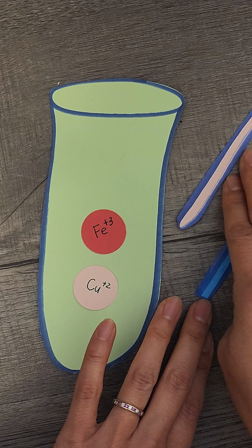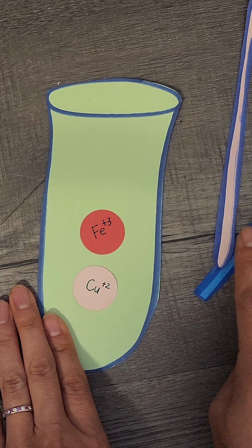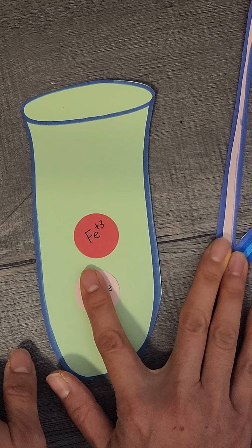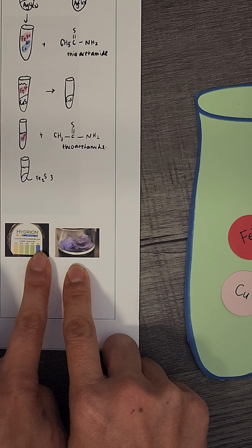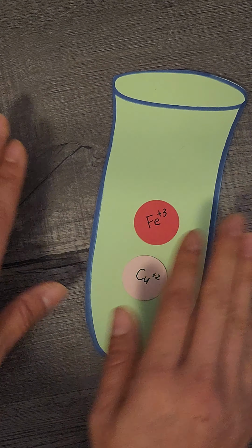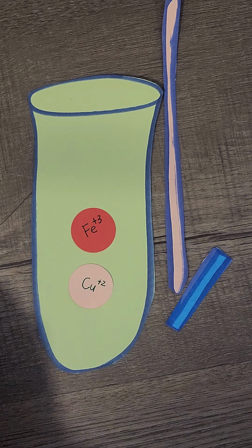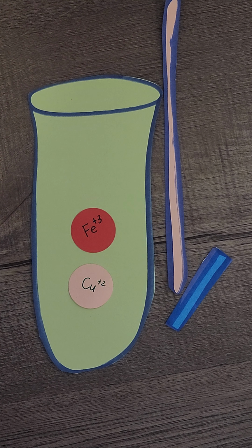The litmus paper on this one, there are different kinds. There will be 3 that you'll be introduced to, but this one looks something like this. So in a real scenario, it looks like this, and the pH scale is here. We want this to be acidic. Well, how acidic? We want it to be a pH of approximately 0.5.